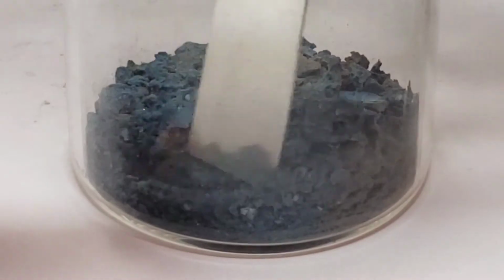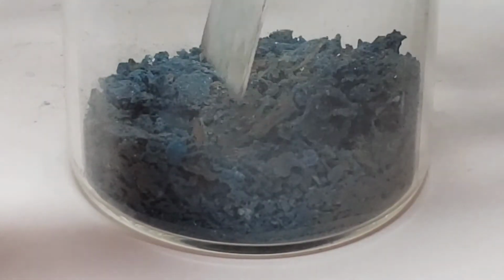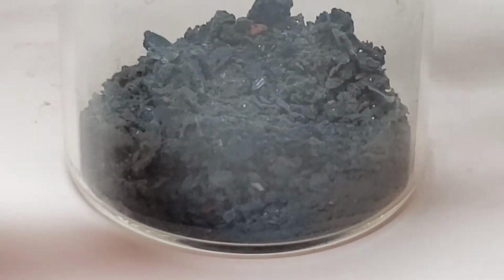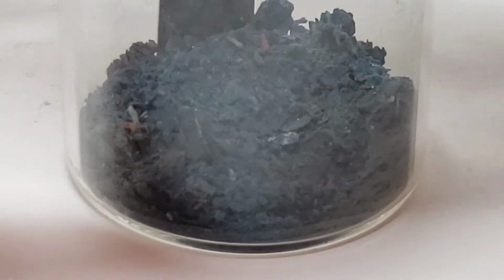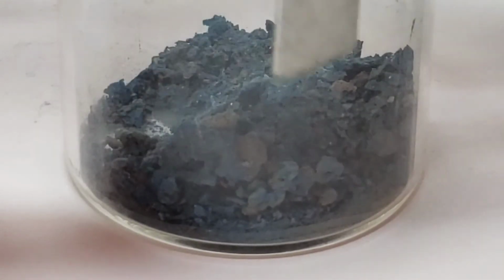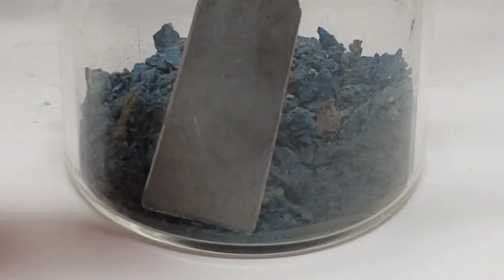But anyway, that was a complete failure. And you can see here the garbage that I was left with. You can see, again, the little bits of copper and copper acetate, and little whitish bits that are the aluminum acetate, but it was kind of just a complete mess. So yeah, don't make that mistake.